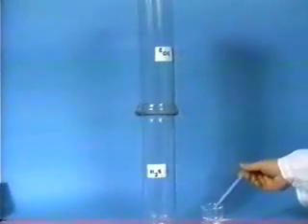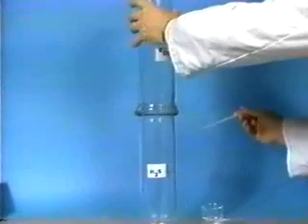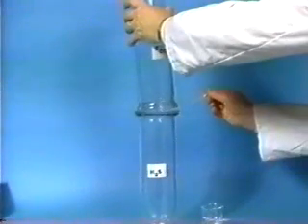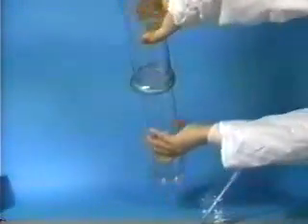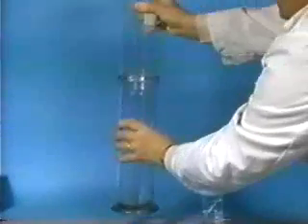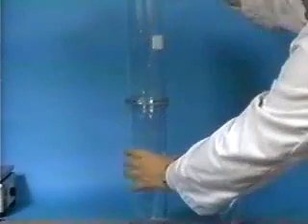Now, after a few minutes, we are going to add a few drops of water to the gas mixture. Water catalyzes the reaction between H2S and SO2, so that on inverting the jars to distribute the water, we begin to see the product of the reaction — solid sulfur — coating the walls of the gas jars.